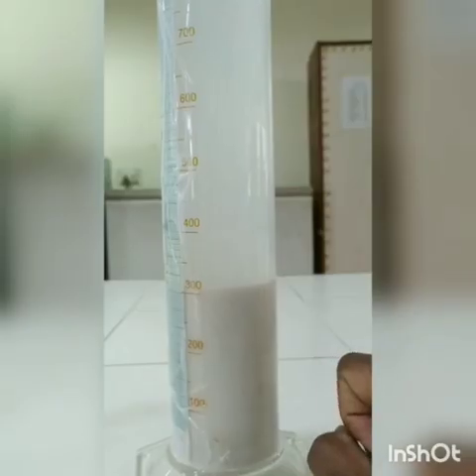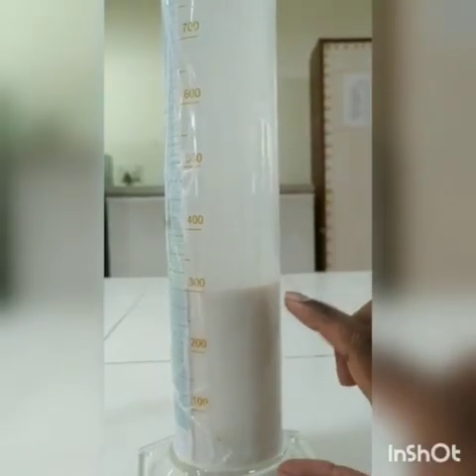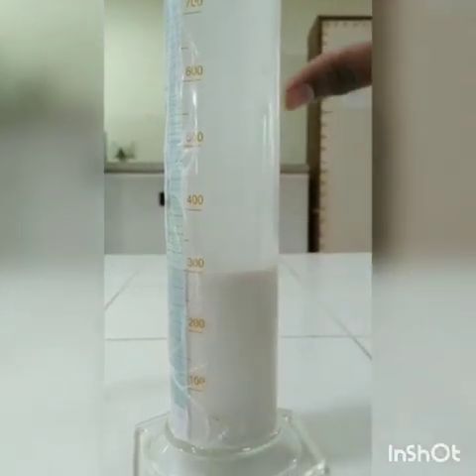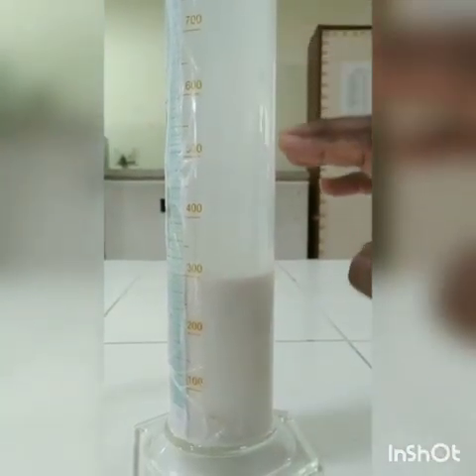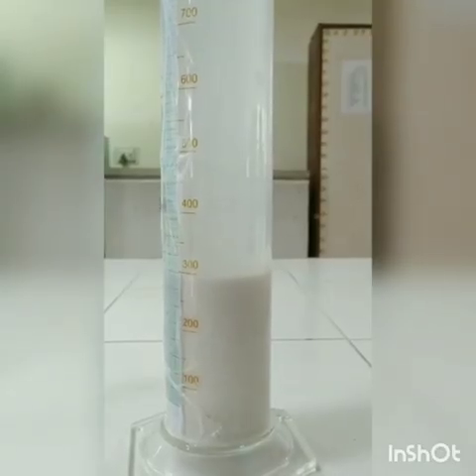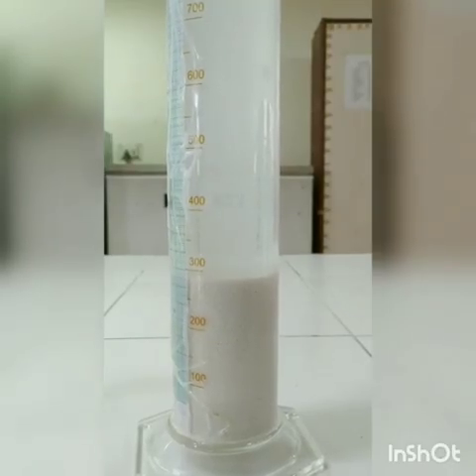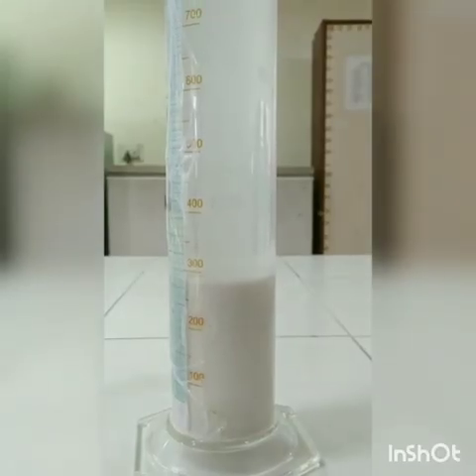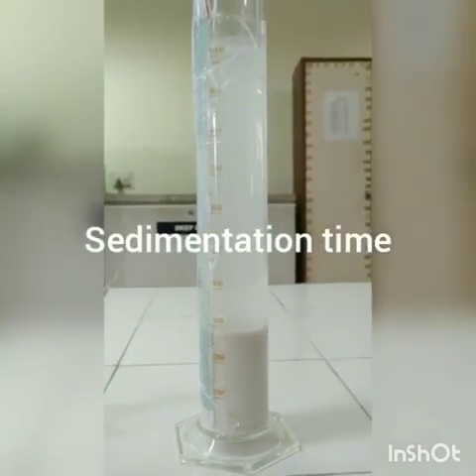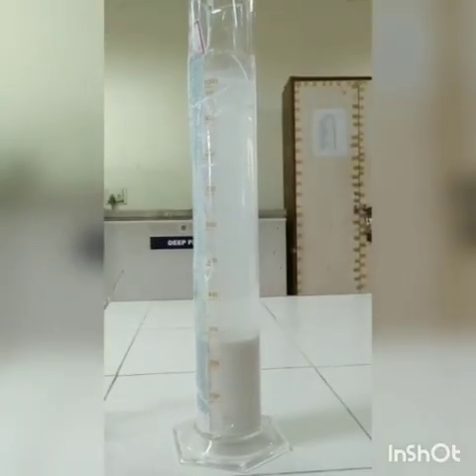Now you can see the clear demarcation between the lime that has been added and the water, and you can see the particles flowing throughout the column. So this is the batch sedimentation. We need to plot the graph between the velocity and the time: how much length the particle sediments with respect to time.